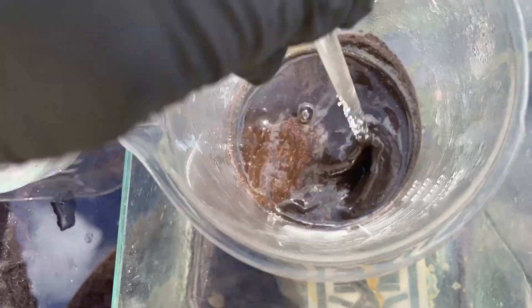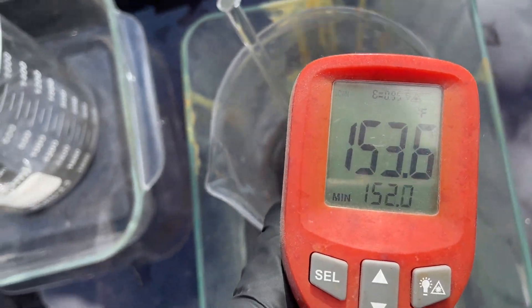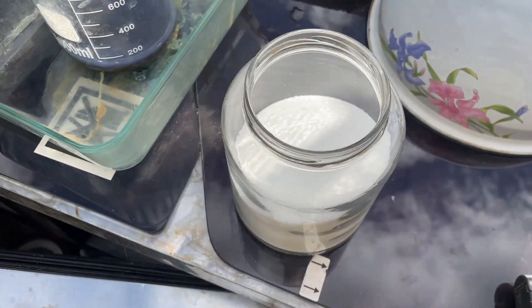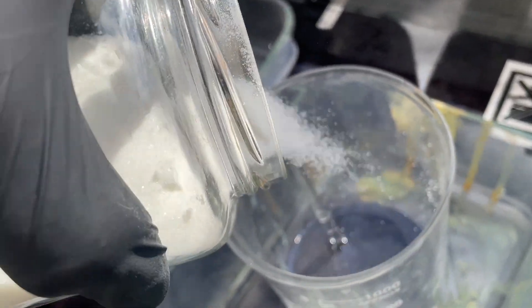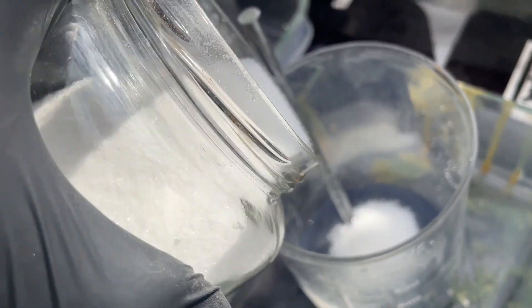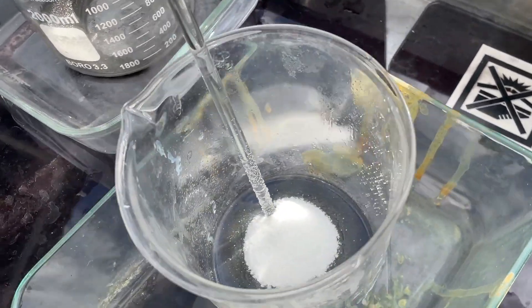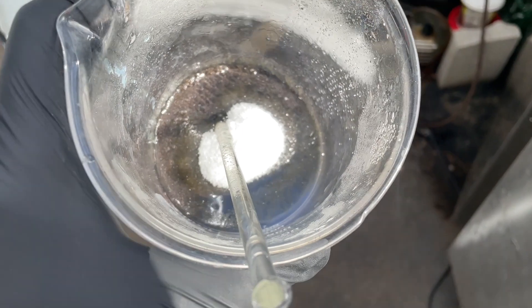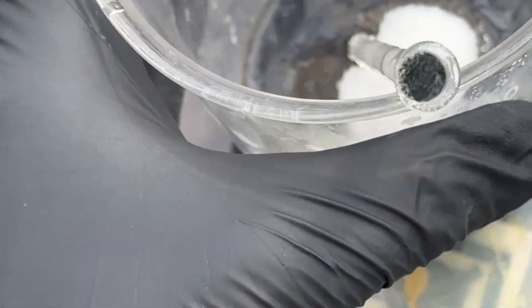One more temperature check — oh yeah, it's cooling off already. Now I've got regular old table sugar there, stuff you put on your cereal. I'm just going to put a pile in there again like I did yesterday because I want to see the reaction a bit. I don't want it to foam over. You can see it kind of turning gray around the sugar — it's converting some of that to silver metal already.